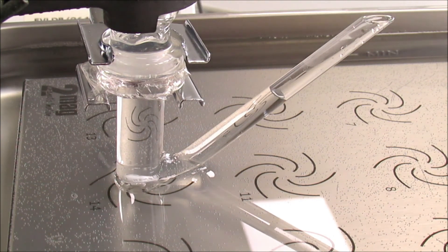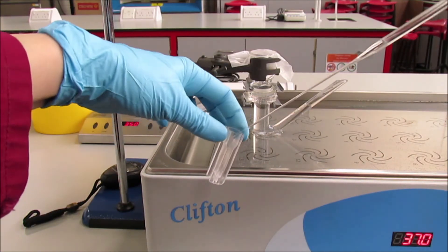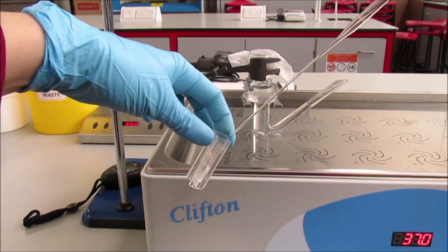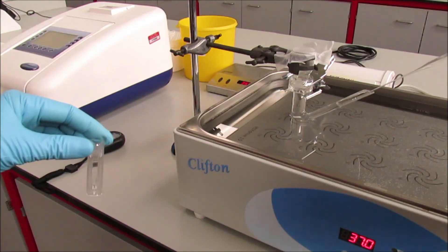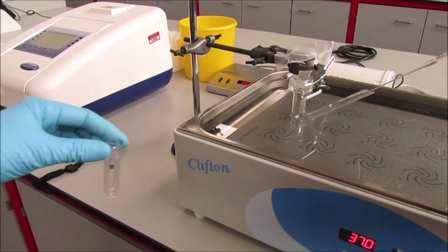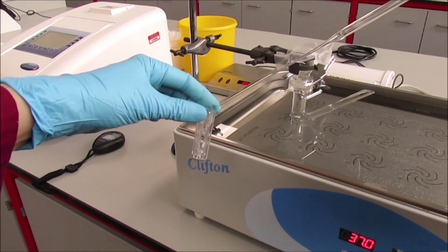For doing that we need to place the sample into the cuvette. We need to place enough sample into the cuvette so the spectrophotometer can provide us the correct reading.